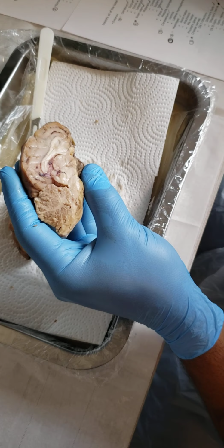And then what else do we have? The oculomotor is right here in this section. Right, next, make sure I didn't miss anything. Brainstem, we talked about the brainstem right here. The pons, medulla oblongata.